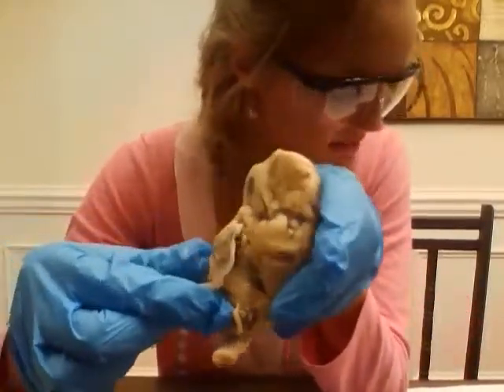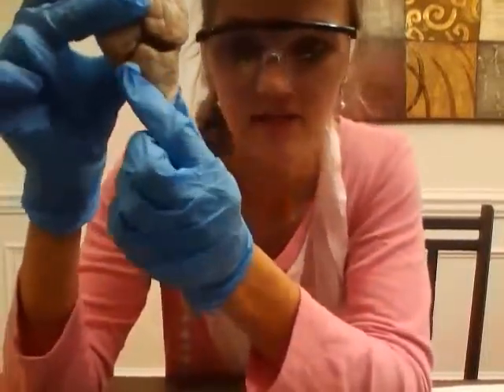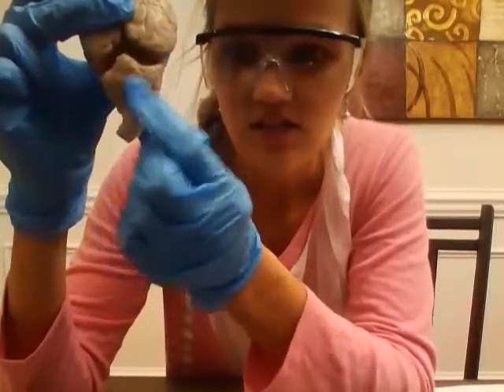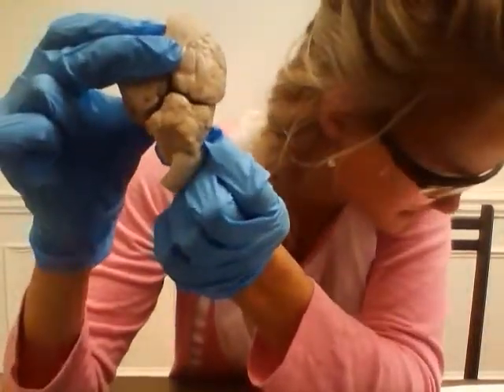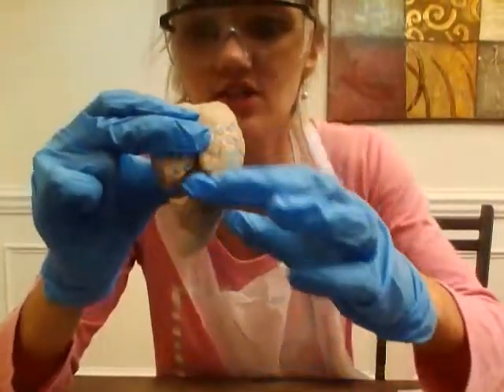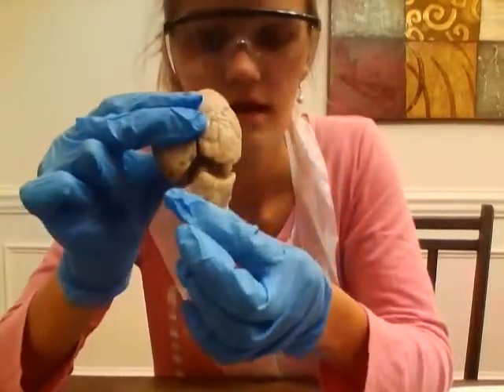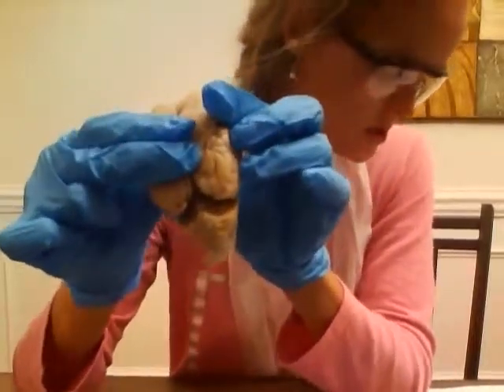Then moving on, we have the cerebellum right here, and then we have the vermis, which are going to be these little worm-like structures, but they just make little lines. And then we have the lateral hemisphere. I'm not sure if you're talking about the transverse fissure or if you're just talking about the left and right hemispheres of the cerebellum or the cerebrum. So I'm not sure on that one.